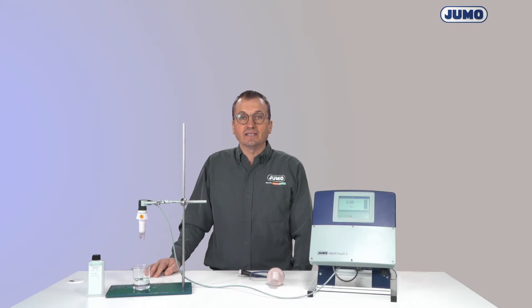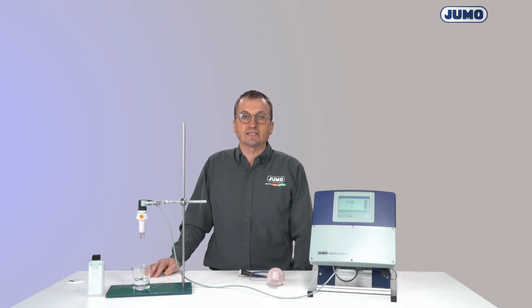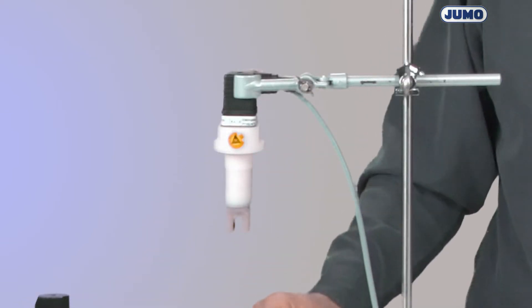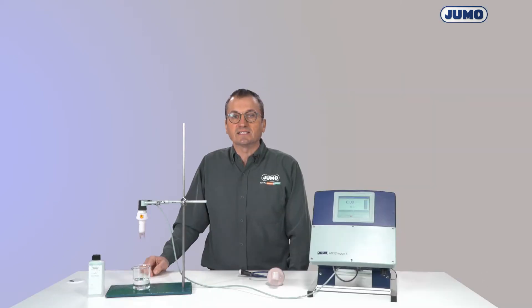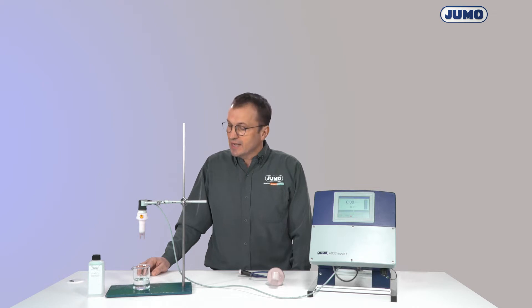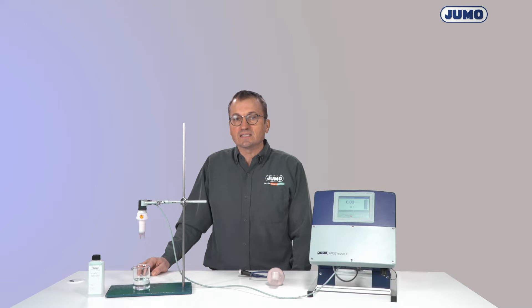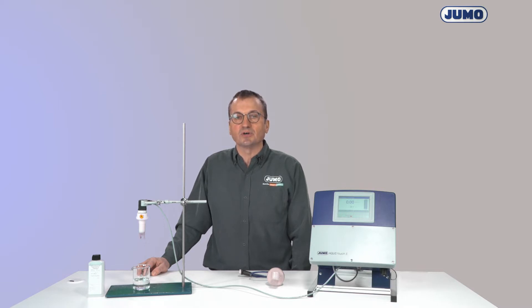The measurement of conductivity is usually done with measuring cells like I show you here. This here is a two-pole conductive conductivity cell. Cells based on this principle measure very small conductivities up to a maximum of 15 mS per centimeter. For cells of this type, I will show you the necessary calibrations.